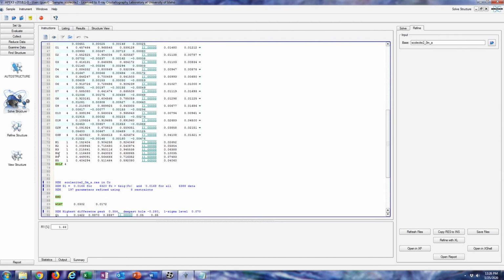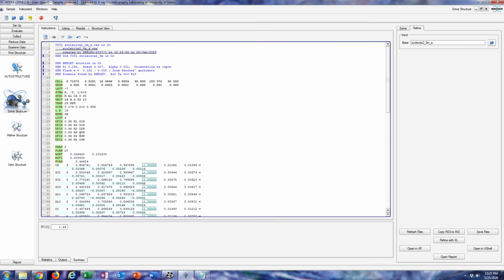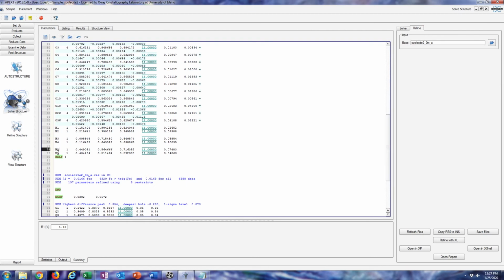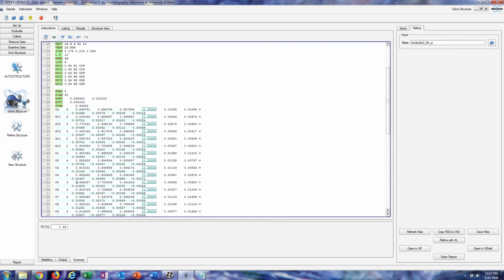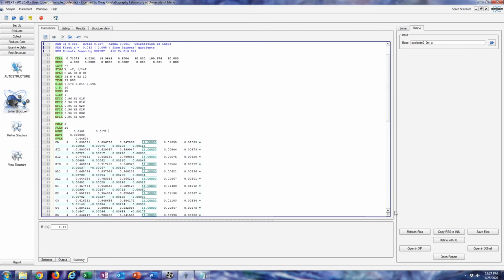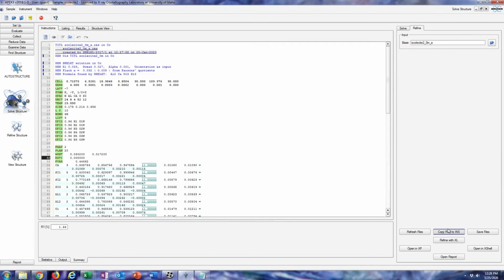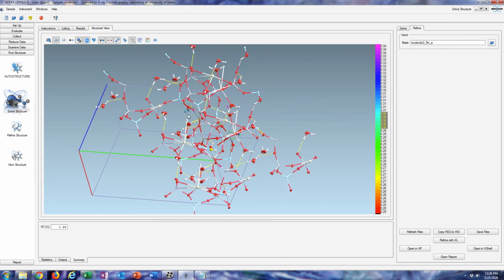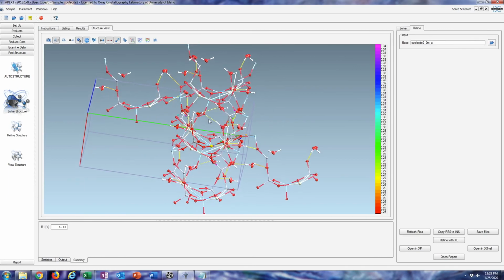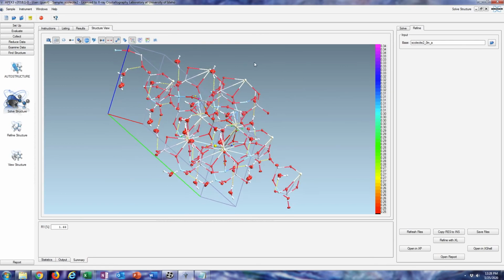And from here, I'm just going to rename these just to clean things up. Oxygen 1W is H1 and 2. Alright, and I'll just shift our weight, click refine. Alright, looking pretty good. That's pretty much the basic structure at this point.